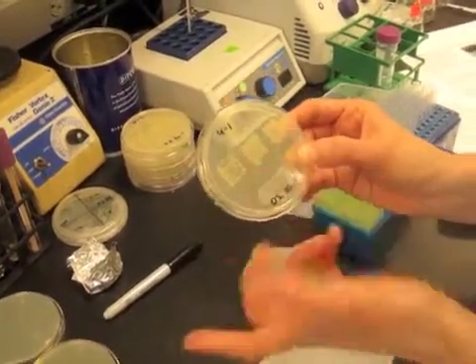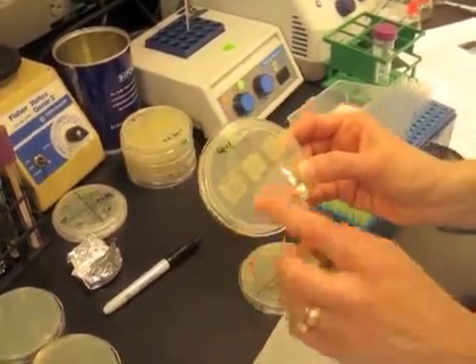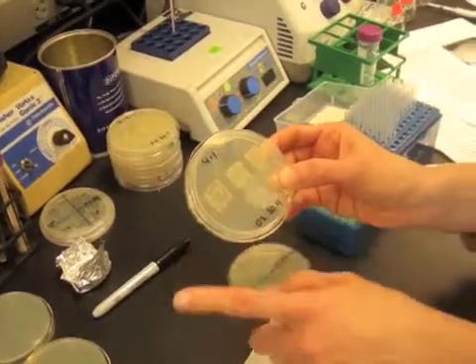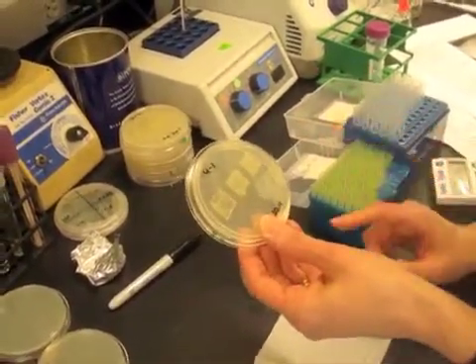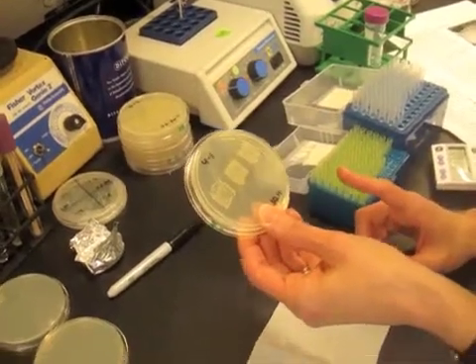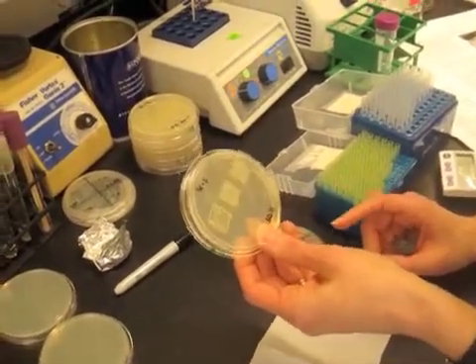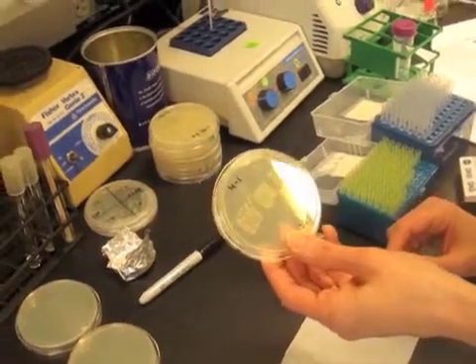I would keep the strains 4-1 and 4-2 on separate plates, partially just to keep things from getting cross-contaminated, and also to make it a little bit easier for the students to find the cells they need when they run their labs.